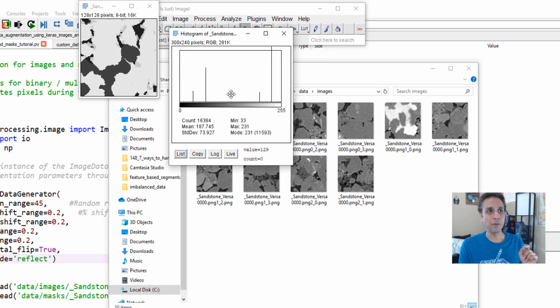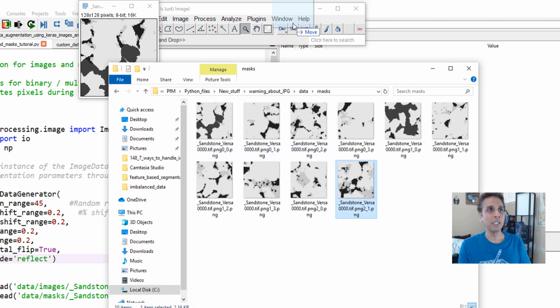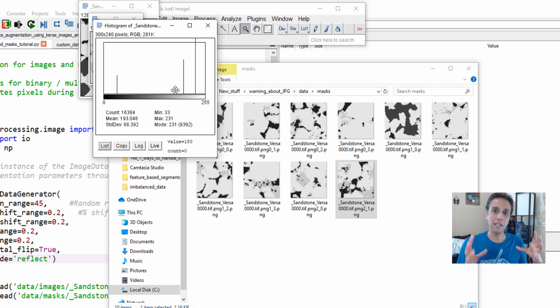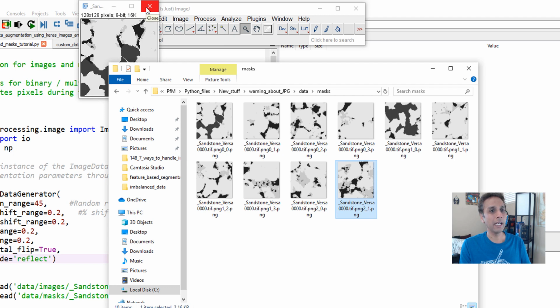And it's very important for me to keep these numbers. So it doesn't matter what mask I actually pick. These are the four values that I should be seeing, because these are the labels for my challenge here, for which I'm trying to build a deep learning or a machine learning model. Now, why am I warning you about JPEG?